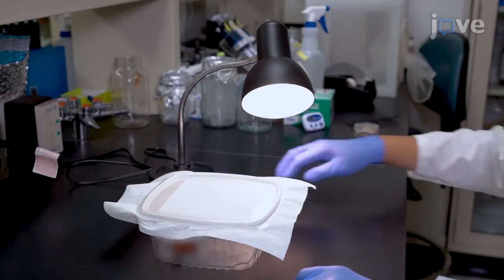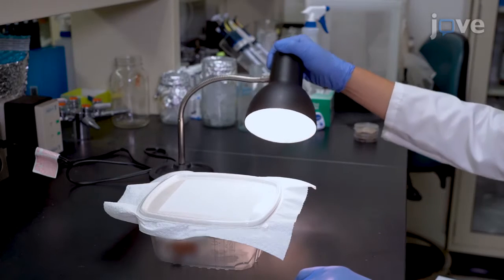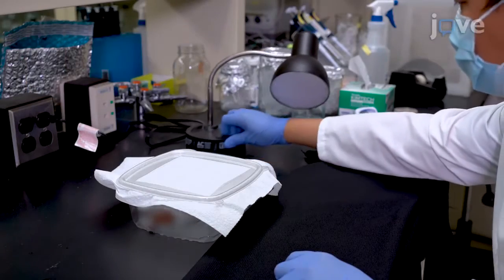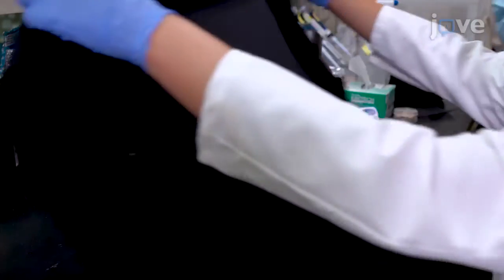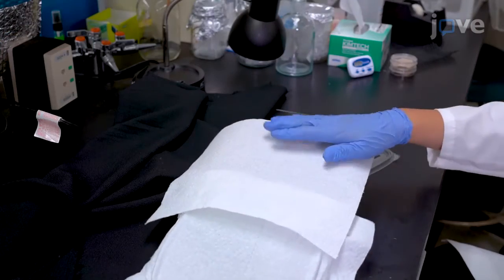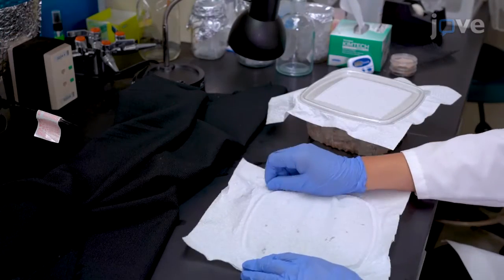On day 2 post-eclosion, expose the adults to intense light overnight. On day 3 post-eclosion, transfer the adults to a dark place. Collect the embryos within 2 hours after oviposition.